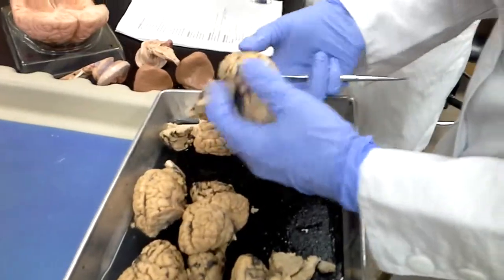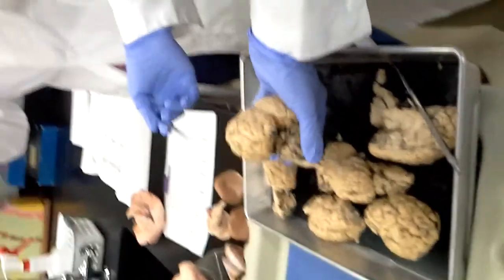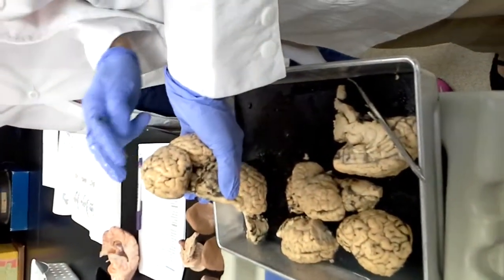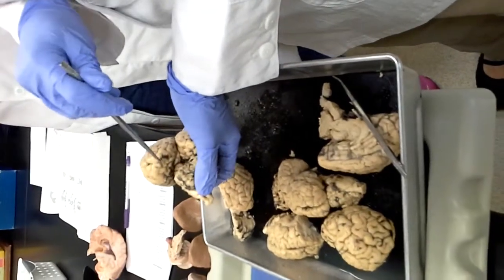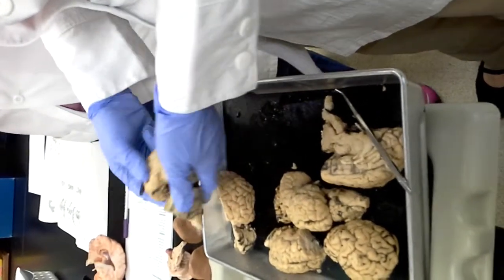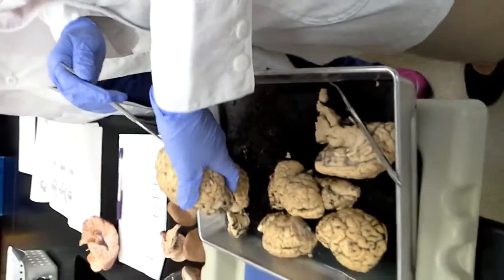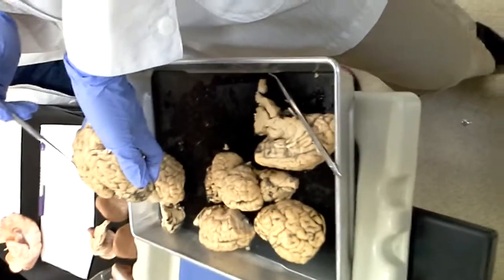Guys probably have all figured that out. It depends, of course, on some of them have been cut in more ways, but we have a frontal lobe, parietal lobe, in the very back, occipital, and then on the side here, temporal lobe. Longitudinal cerebral fissure is the big groove right down that sagittal line. Cerebral hemispheres, each half is a hemisphere.